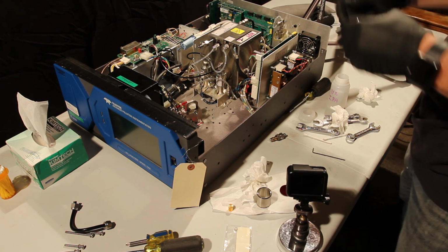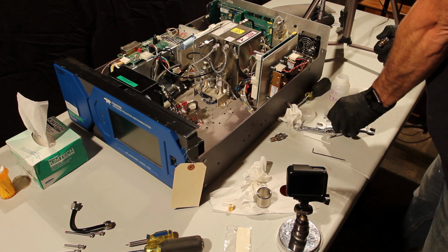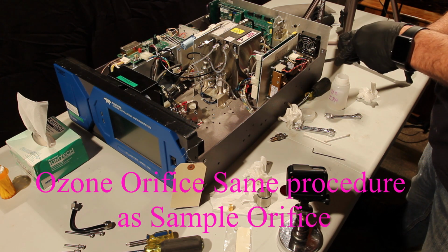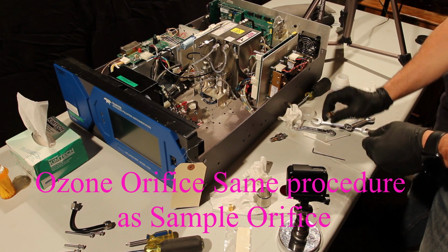You can tighten it back up. Remember, not as tight as I found it. Just snug. It's an O-ring seal, so just snug is perfect. So this was our outer one.